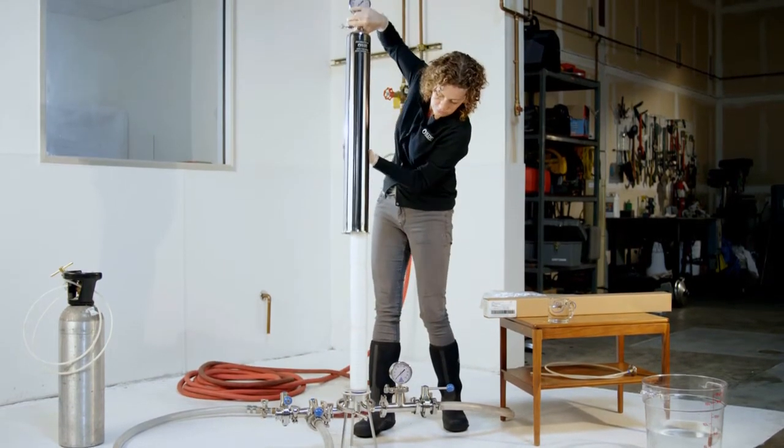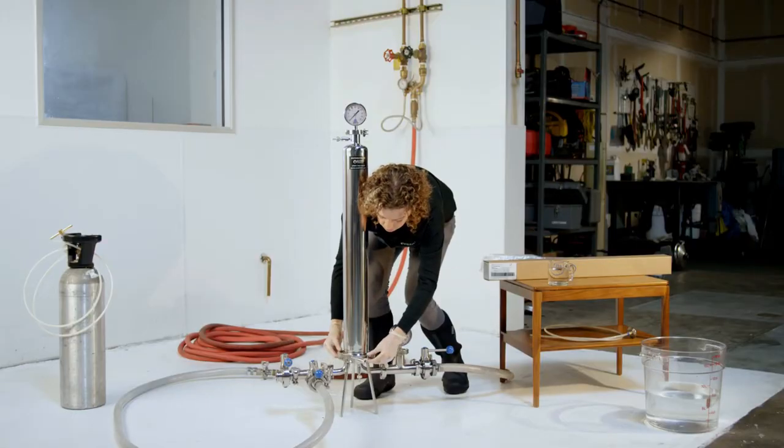Once the cartridge is firmly seated in the housing, place the lid on the housing and securely seal the closure.